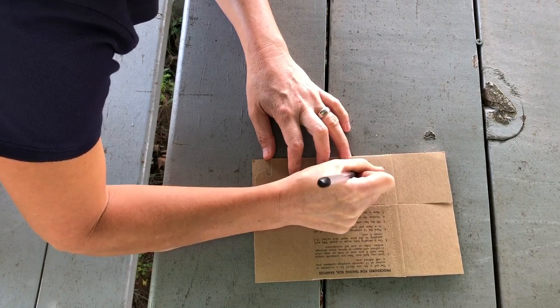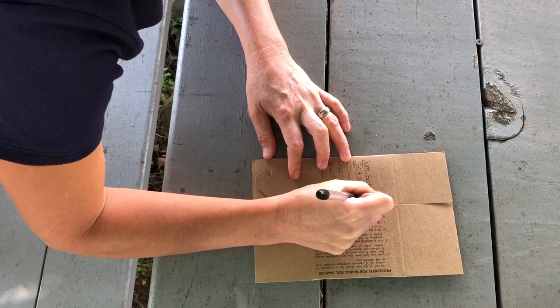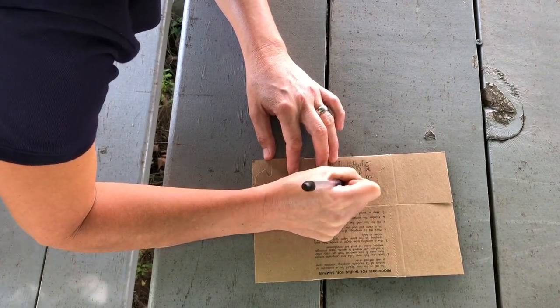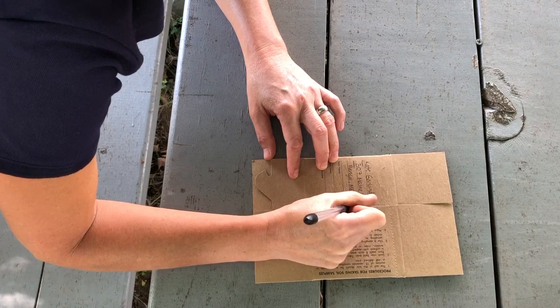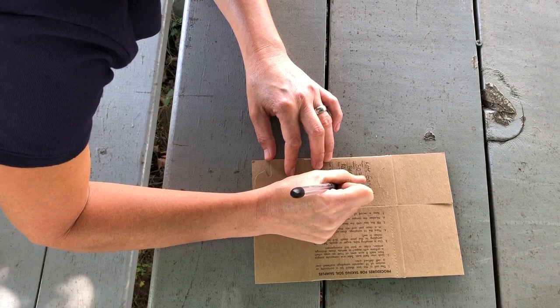Before assembling and filling the boxes, clearly write your name, address, and if applicable, farm name, field name, and sample number. Homeowners may want to write down references such as front lawn, back lawn, east vegetable garden, etc. in the field name section of the box in order to keep track of multiple samples.